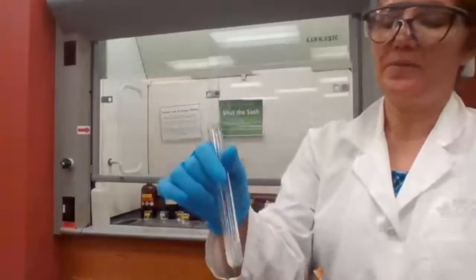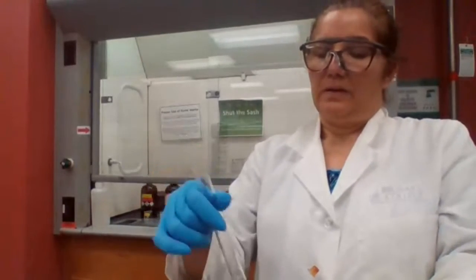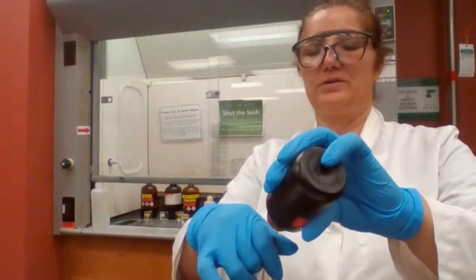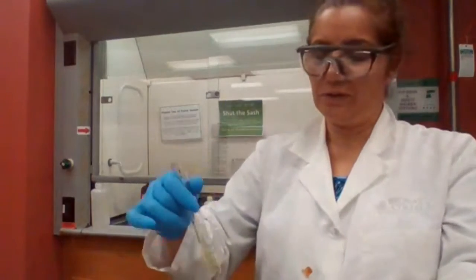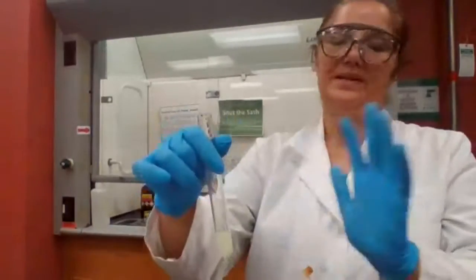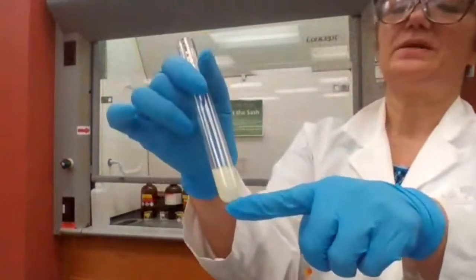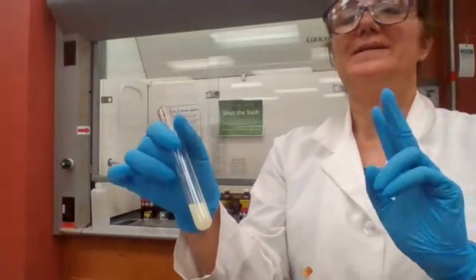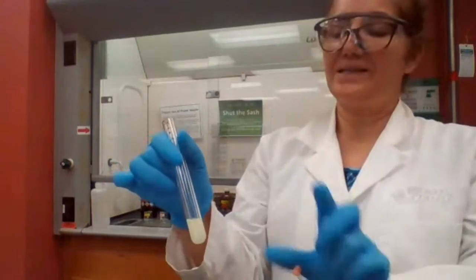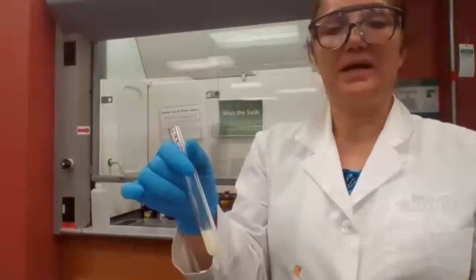How much of the iodine solution should I add? There are two conditions where I stop adding iodine solution. I hope that part is clear in the procedure. One condition is I see a yellow precipitate, then I stop. That's one condition. Very good. A second condition is that I see this orange red color stays here, but no precipitate. It's clear. That means I have added enough iodine.